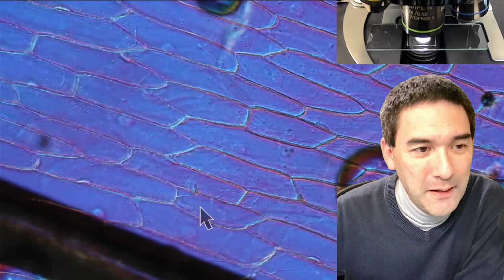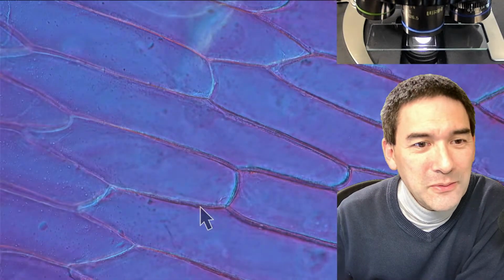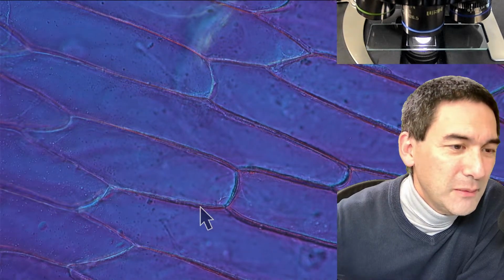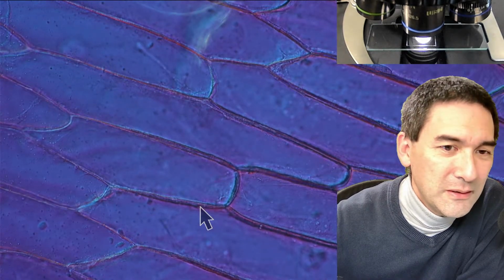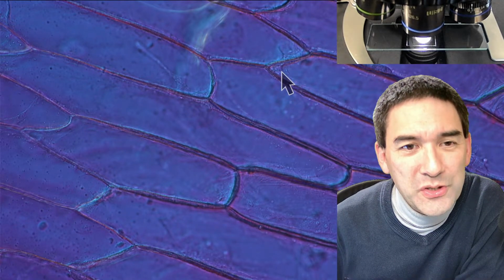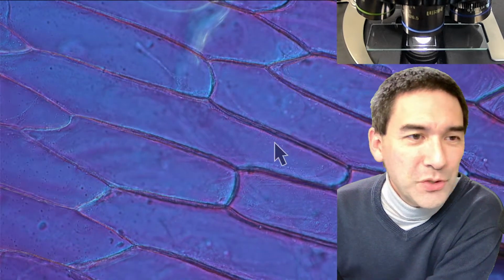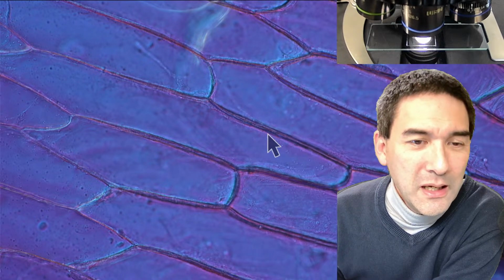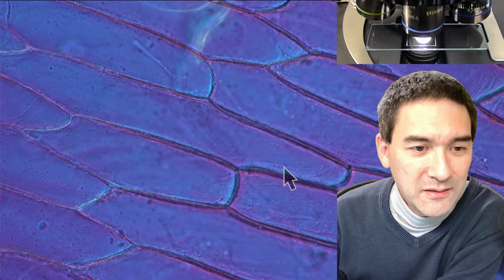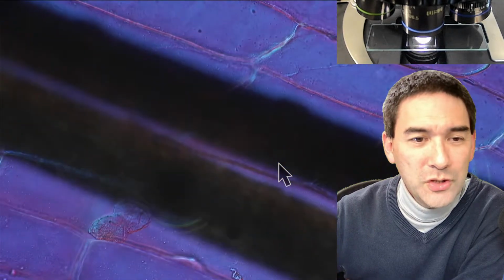And maybe just because we've got onion cells here under the microscope, let's do the following. Now let's make it brighter here. I don't know if you're able to see this. It's difficult. You've got to be really super patient. But sometimes you see those tiny dots. Maybe I have to open this a little bit. You see these are vesicles, those tiny dots, and I don't even know if you're able to see it properly over the live stream. But these vesicles actually move around and transport substances inside the cell. I made time-lapse videos of this, and I just wanted to show it to you.